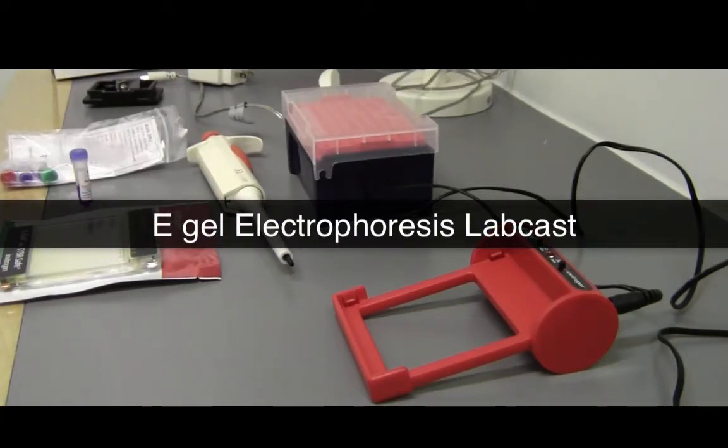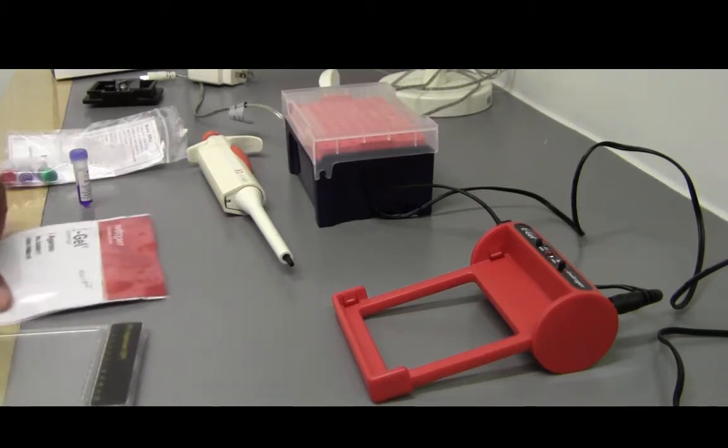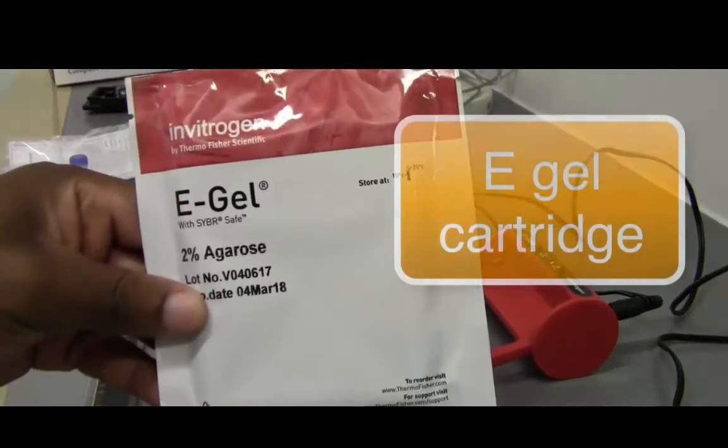So this is the E-Gel LabCast. I'll show you how to load the E-Gel. You will see the E-Gel in cartridges in this container.